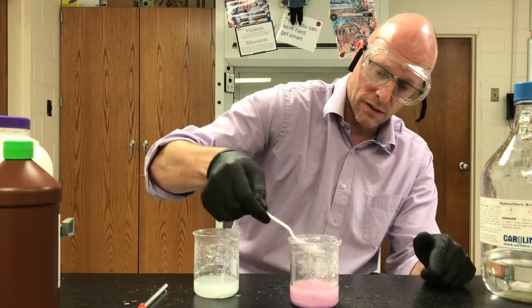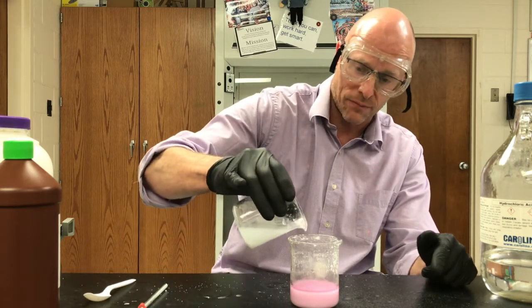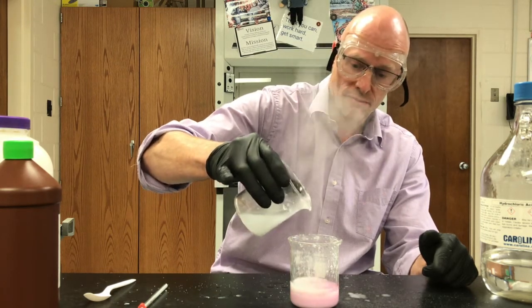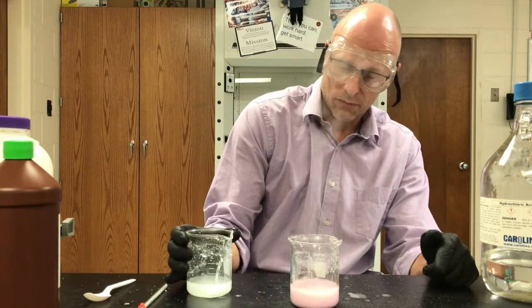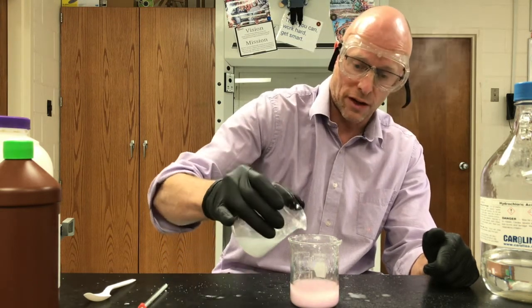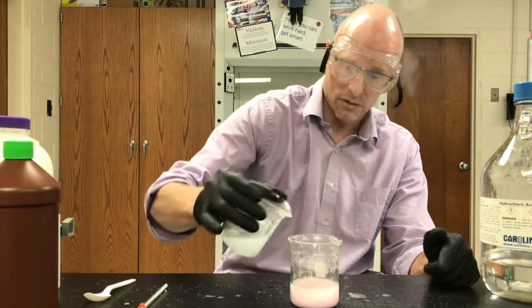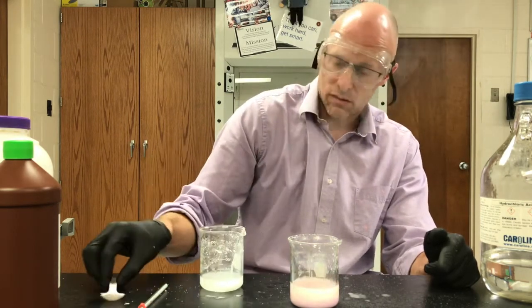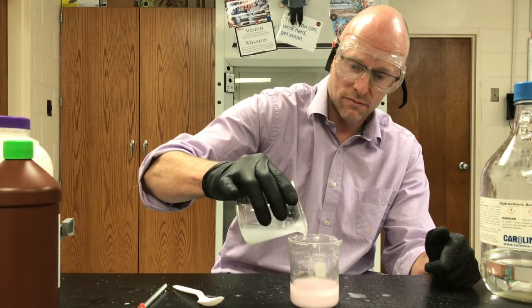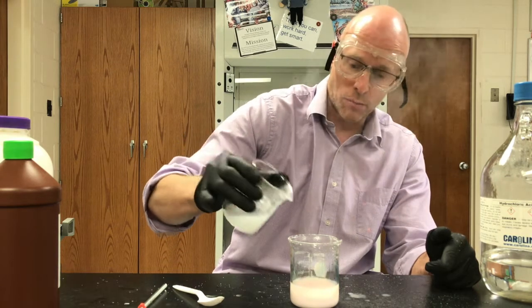I'm looking for a green color — definitely an exothermic reaction; you can see all the steam rising. So what we're forming in there is salt — all of that white stuff you see inside there is salt. But I'm still trying to look for my green color. We're getting a few different colors forming now — I saw some blue, which means we're getting close to neutral.